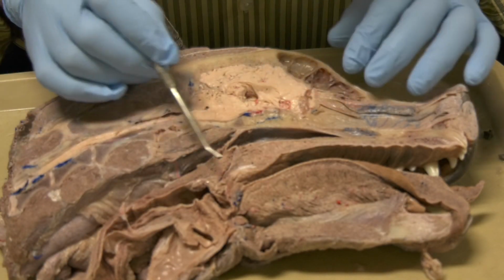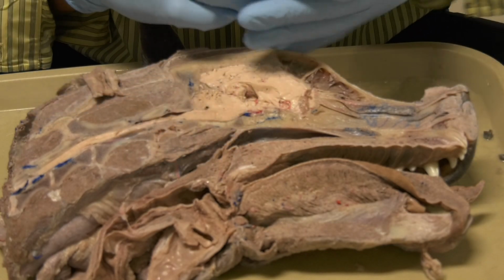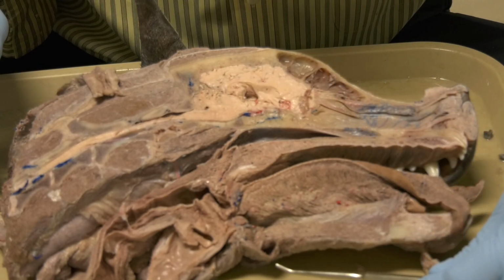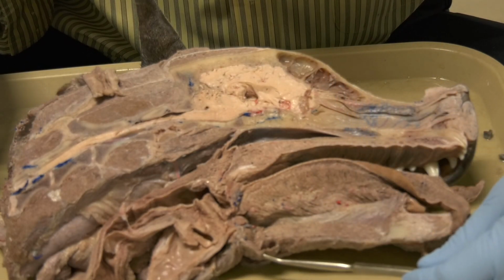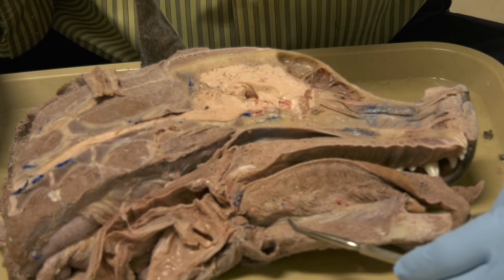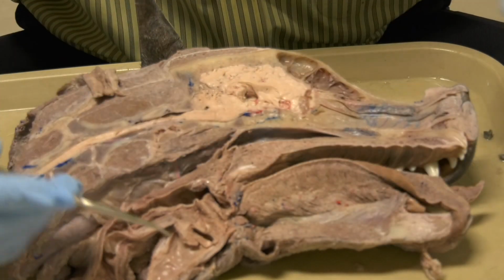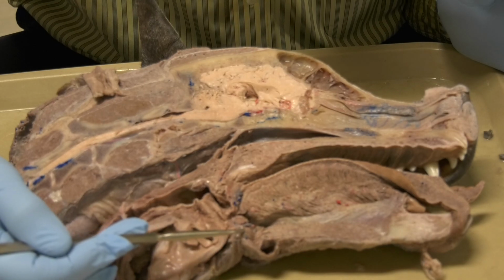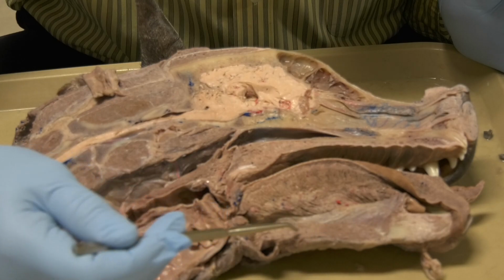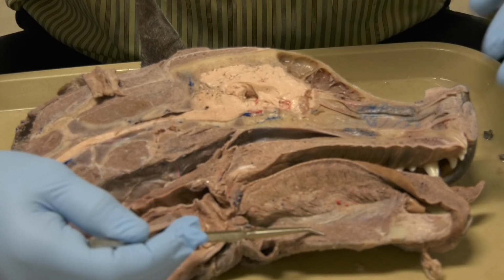Now, when we come to the area of the larynx, let me orient you first. This is the mylohyoideus muscle, and we said this is the thin muscle that sits between the two mandibles. It is this one here. Okay. This is the geniohyoideus. It goes and attaches to the basihyoid bone. This is the basihyoid bone. Okay. This is the mylohyoideus. This is the geniohyoideus, and this is the genioglossus.